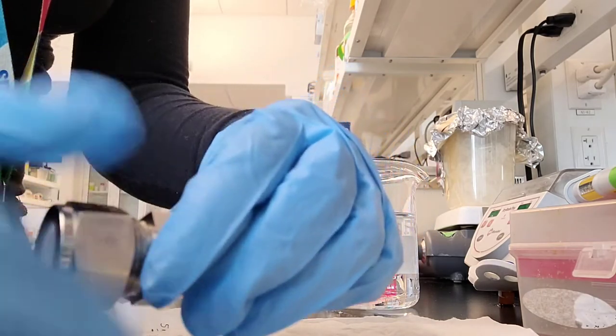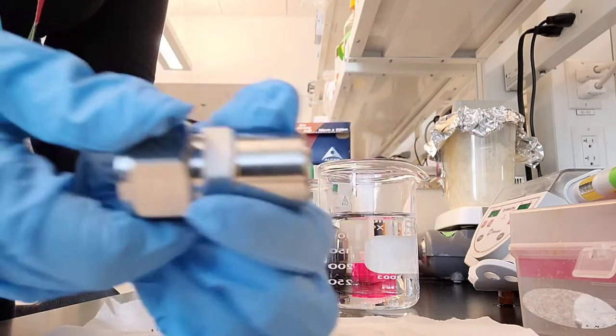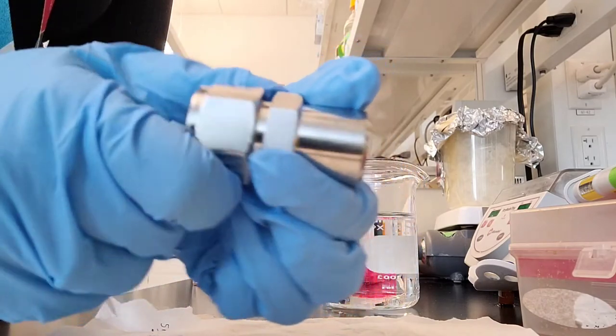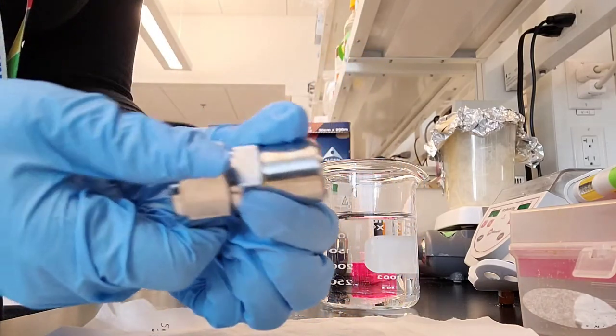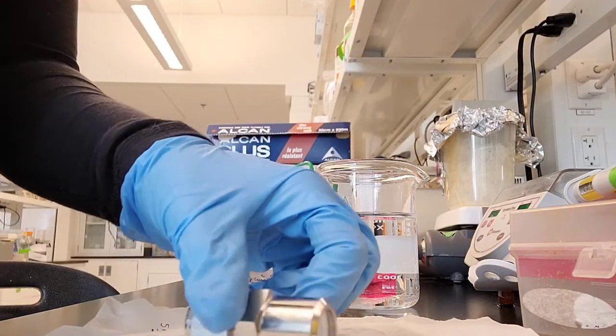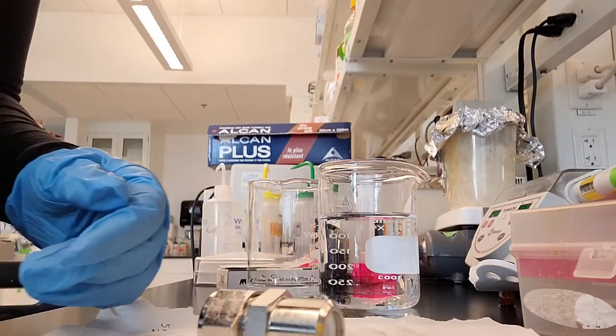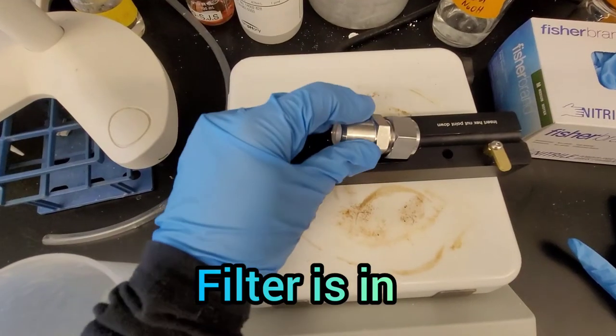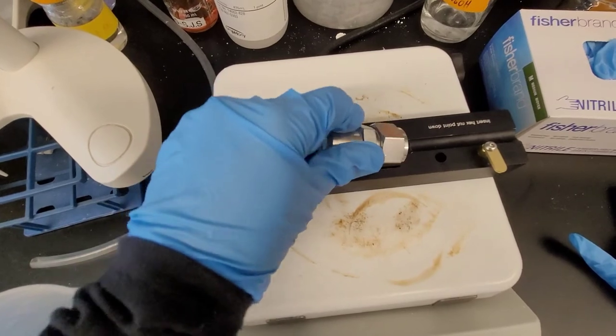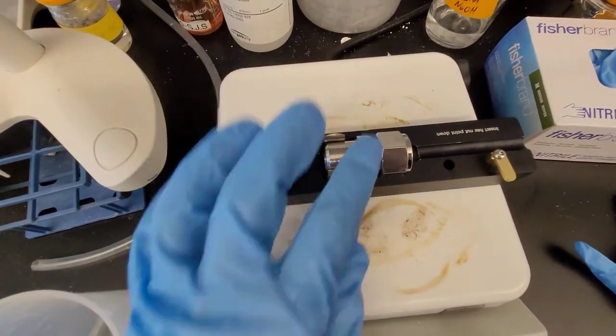Here's the video so you won't forget how to assemble it. Screw it on really tight so you won't have leakage of your lipids, which are kind of expensive. Make sure everything's screwed in well.